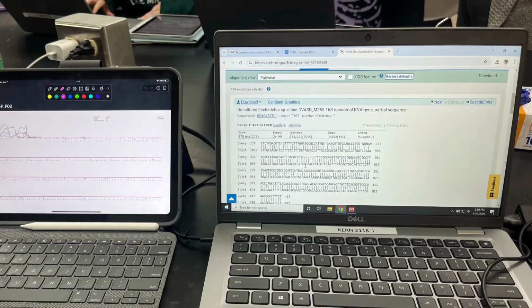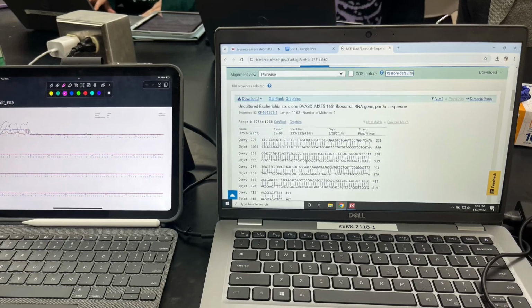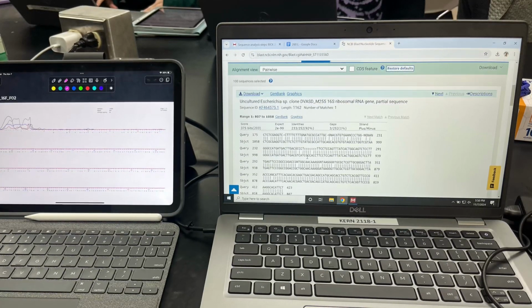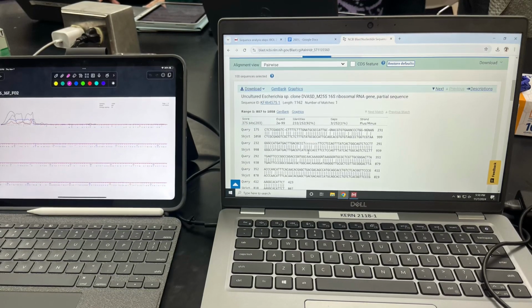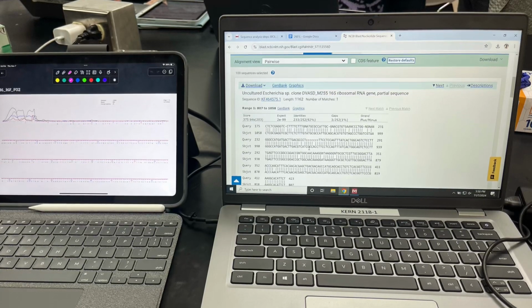Once you get your forward and reverse sequences to overlap, you want to combine them into one sequence. After that, if there are places where the two files disagree, base your call on the one that has the cleanest chromatogram reading. And then you now have two complete 16S sequences, one for each of the unknown bacteria you isolated.